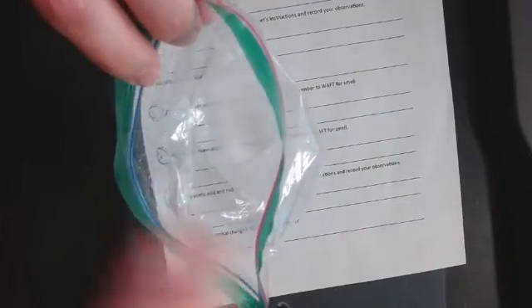Growing up, I did this reaction all the time because acetic acid is vinegar and sodium bicarbonate is baking soda. I knew it made bubbles, but I never knew it got cold. So I saw bubbles, I heard fizzing, and I feel cold. Now let's see if it changed smells. It still smells like vinegar to me, so it has not changed odors.